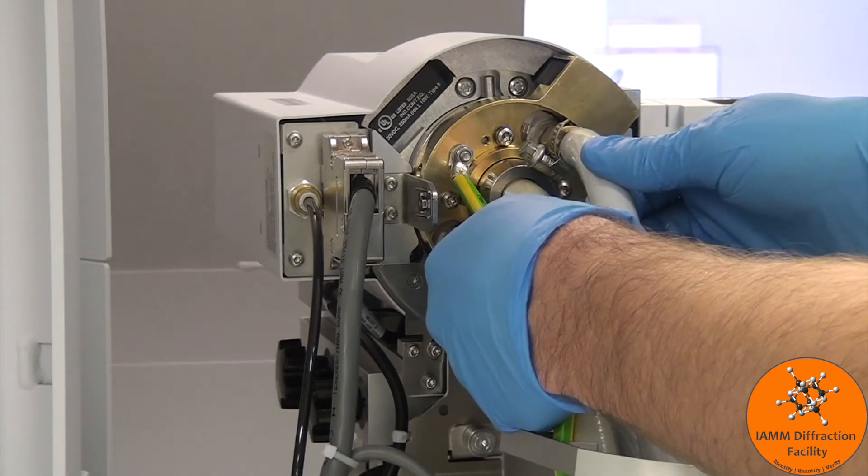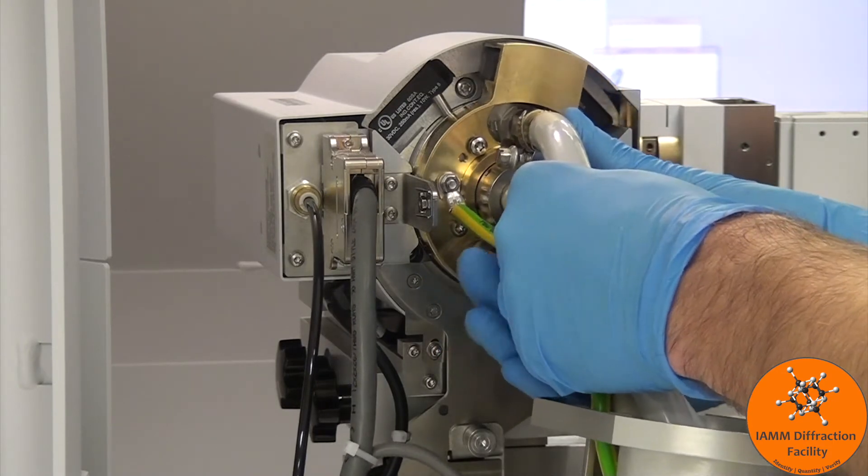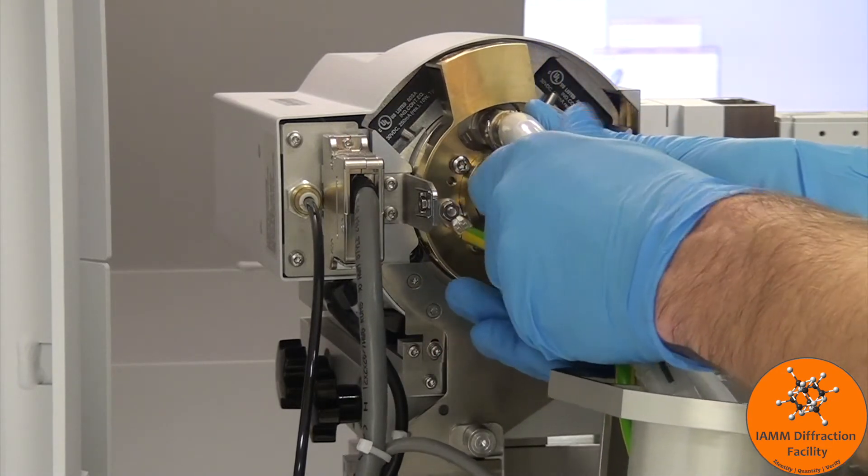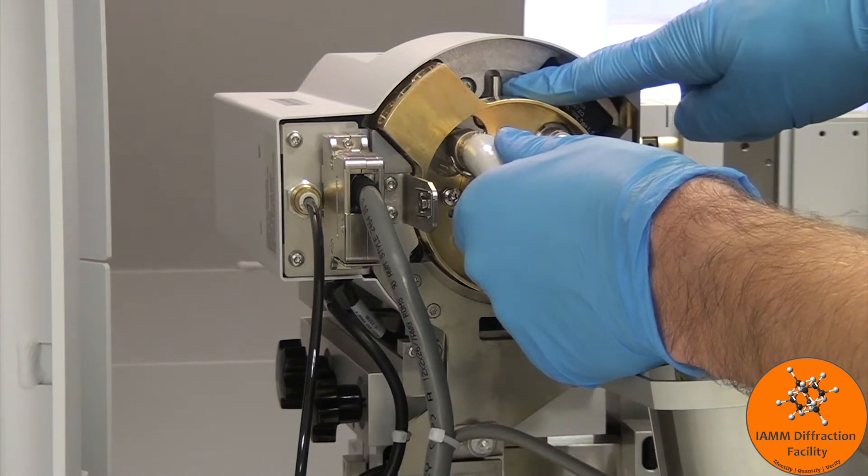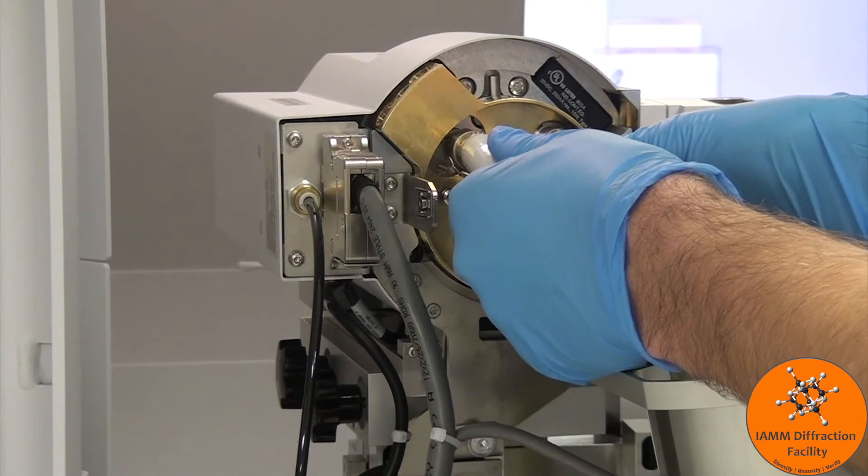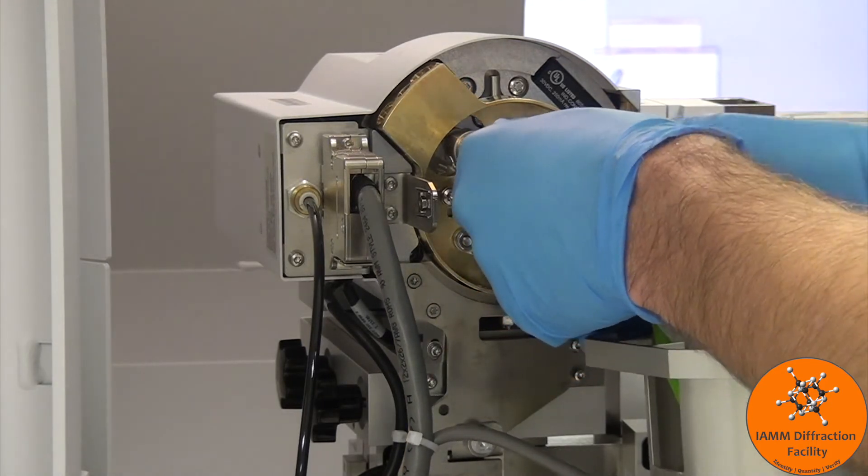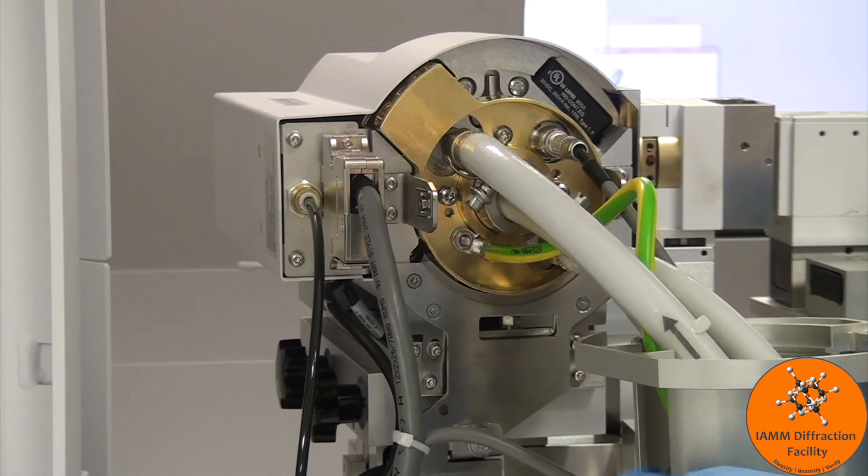Even if I try to pull it more, it's not going to come out more in this position. I will then rotate it counterclockwise. And we have this little rod here that goes into the well. I'll push it back in. And that's it. You've now rotated the tube.